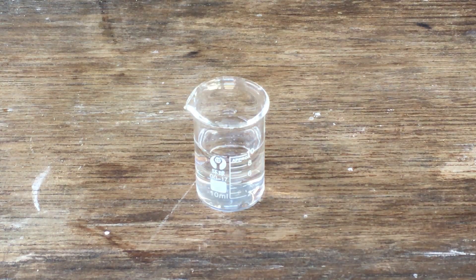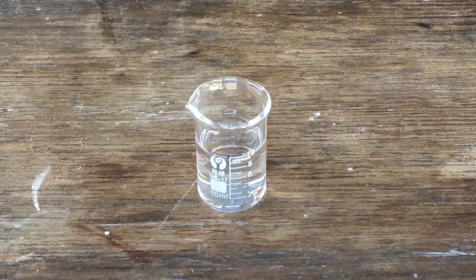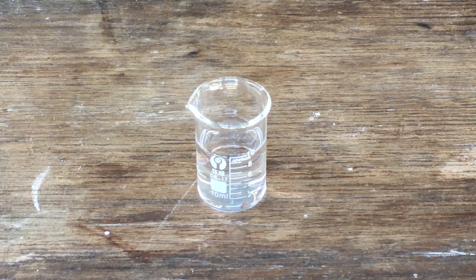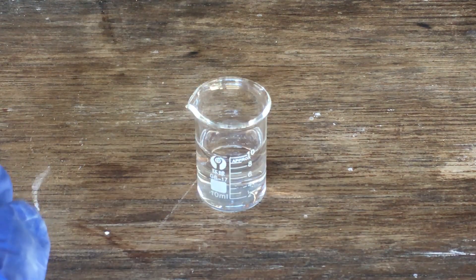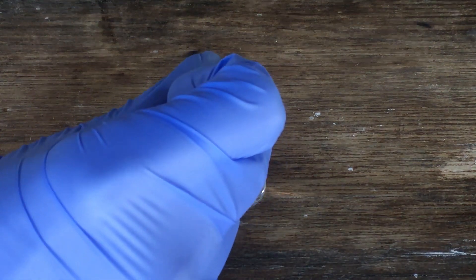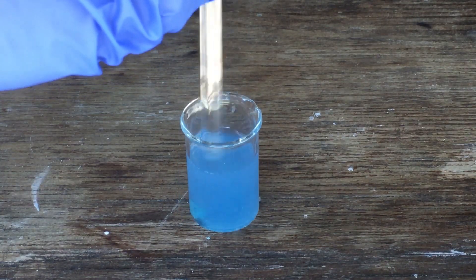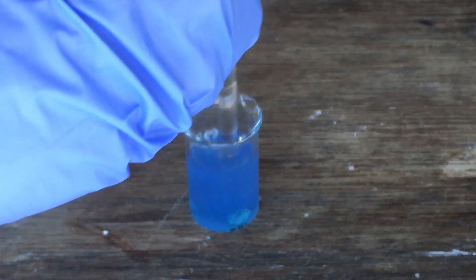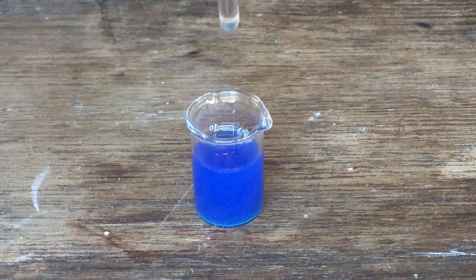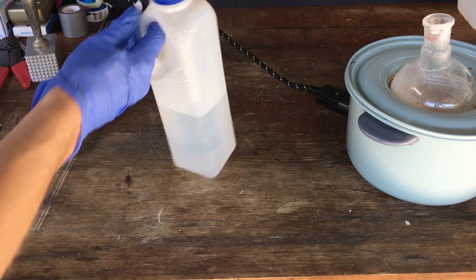As one final cool test we can do with a concentrated ammonia solution — we've got around 10 millilitres of our ammonia here. If we drop in a small amount of basic copper carbonate, normally basic copper carbonate is insoluble in water, but in concentrated ammonia it should dissolve to form a purple solution. You can see that forming there, which is indicative of the tetraamine copper complex. It doesn't show up particularly well on camera, but it is a very, very nice deep purple. There we are — ammonia.